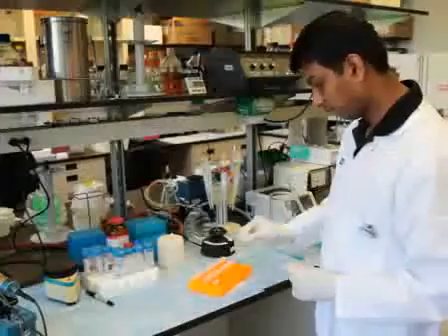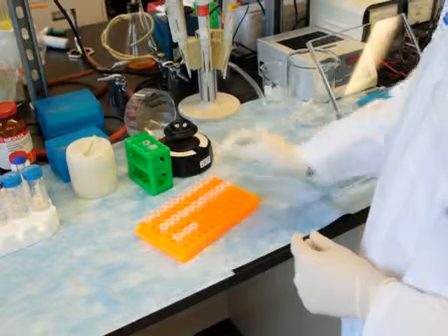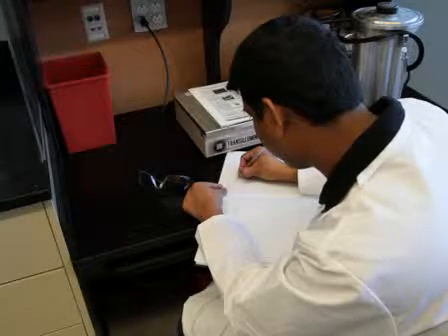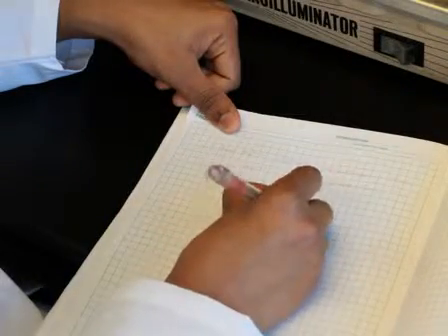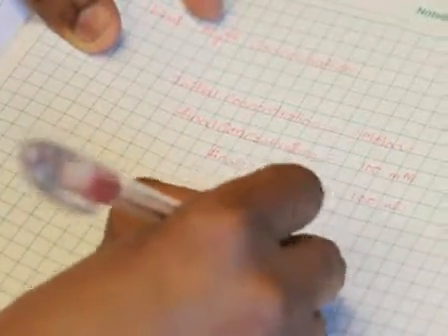To begin the footprinting experiment, set up 27 reaction tubes for enough samples to fill a 30-well electrophoresis gel after including the ladders and uncleaved control. Determine the final magnesium ion concentrations so that they are evenly spaced on a logarithmic scale over several orders of magnitude around the titration midpoint. Preparation of the magnesium ions in 1x reaction buffer is described in the text.